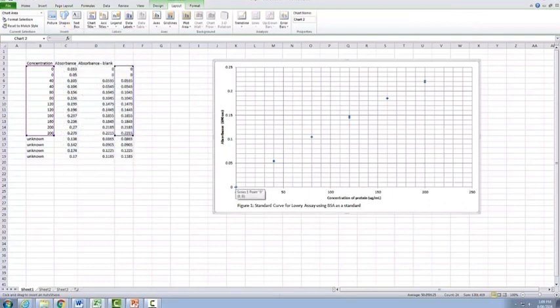So what we actually will do is, if you line up your cursor right here on the 0, you can see that my crosshairs here are exactly on the 0 point. You hold down your mouse button and then you can draw your line of best fit up. And you can alter this line of best fit to wherever it needs to go.